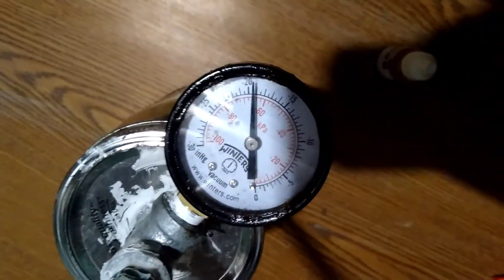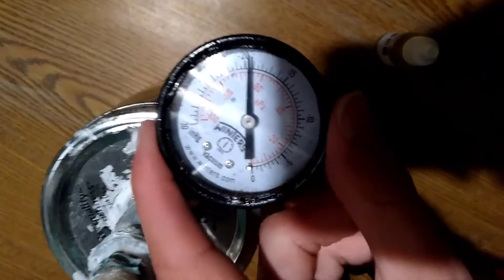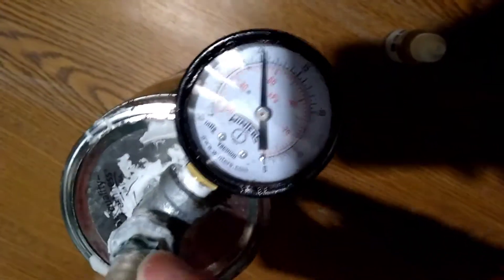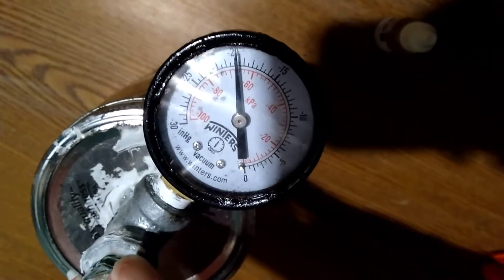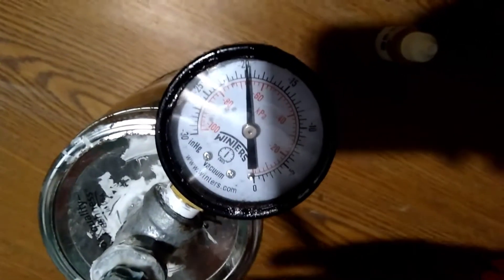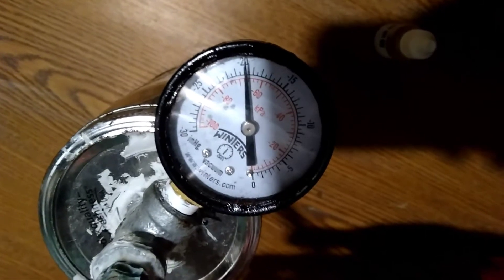So we'll get to about negative 20 inches of liquid mercury. And beyond that, we won't really get too, too far. But I'll leave it running in the background, nevertheless.